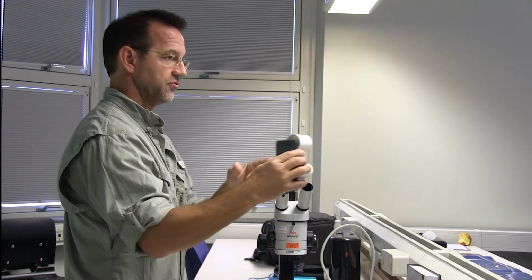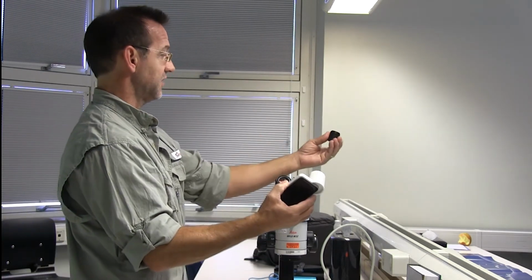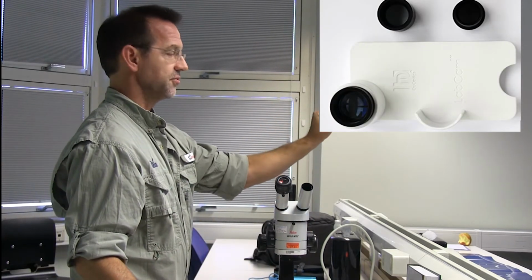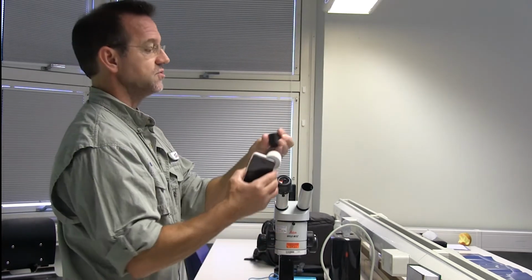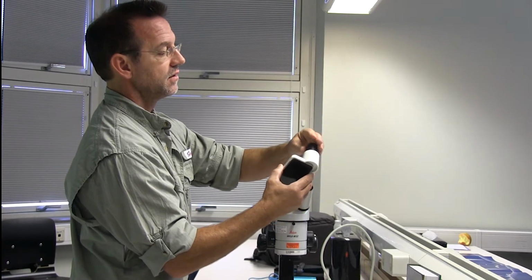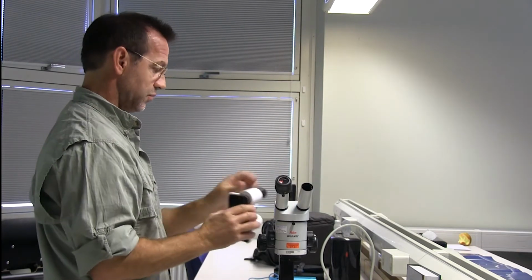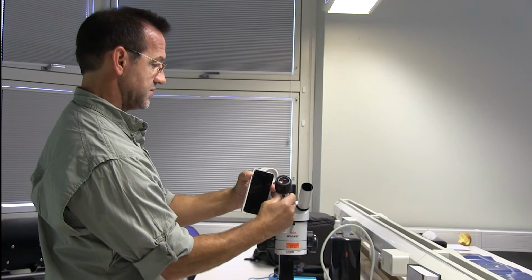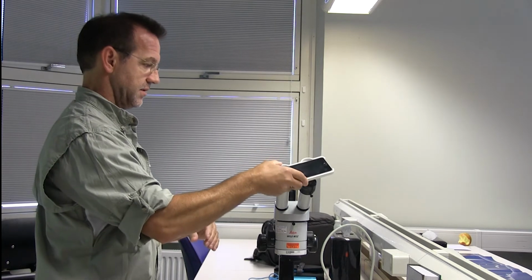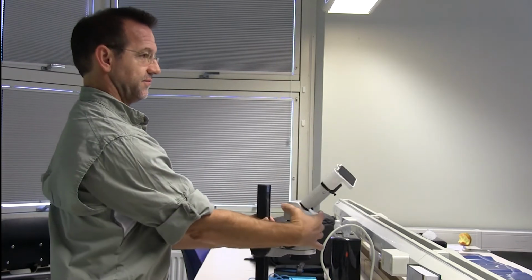And then it's the same principle. How do we get connected to the microscope? Same technology. He has a 30 millimeter adapter or a 23 millimeter adapter. So same thing. You would just thread this in to here, and then it slides into the microscope eyepiece, but you would want to remove this eyepiece and have it around on this side because there's nothing over here. And then your image comes up on the screen right here.